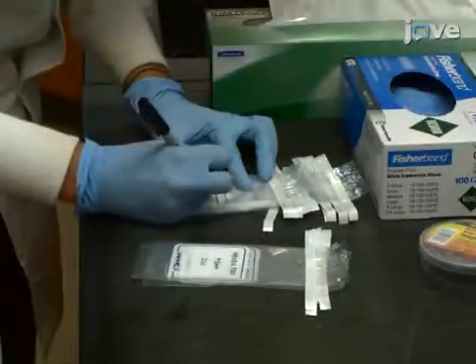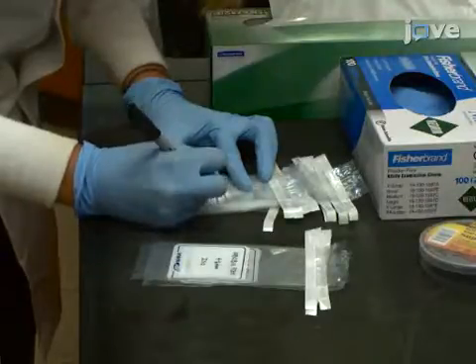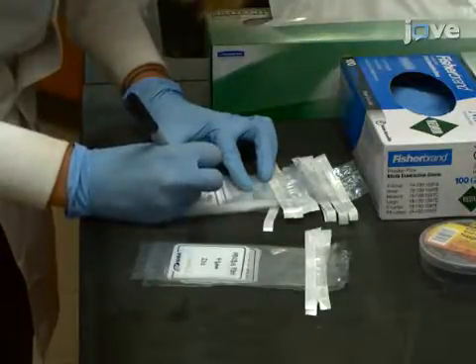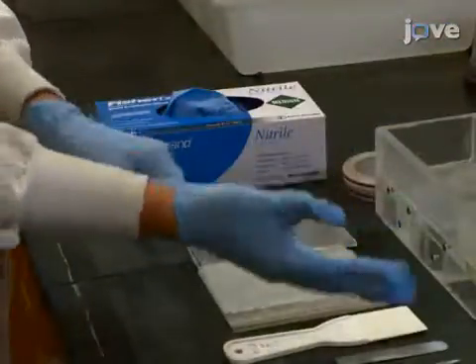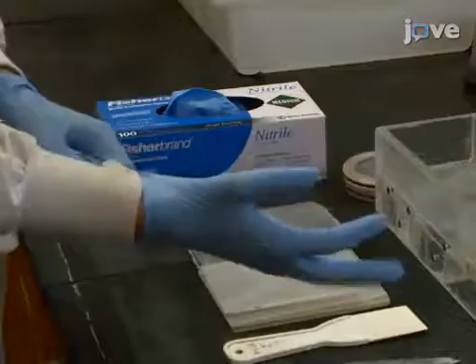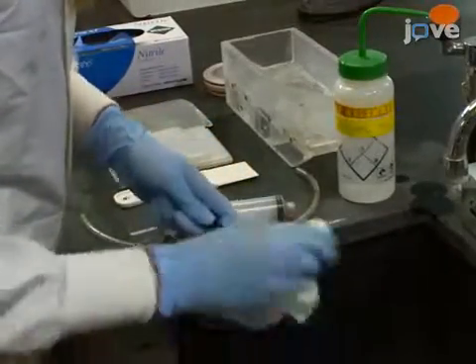Begin with preparing labeled sub-sample vessels. Select appropriate vessels based on the type of analysis. Also, have sterilized protective gear at the ready. Then assemble and sterilize all the necessary cutting implements.